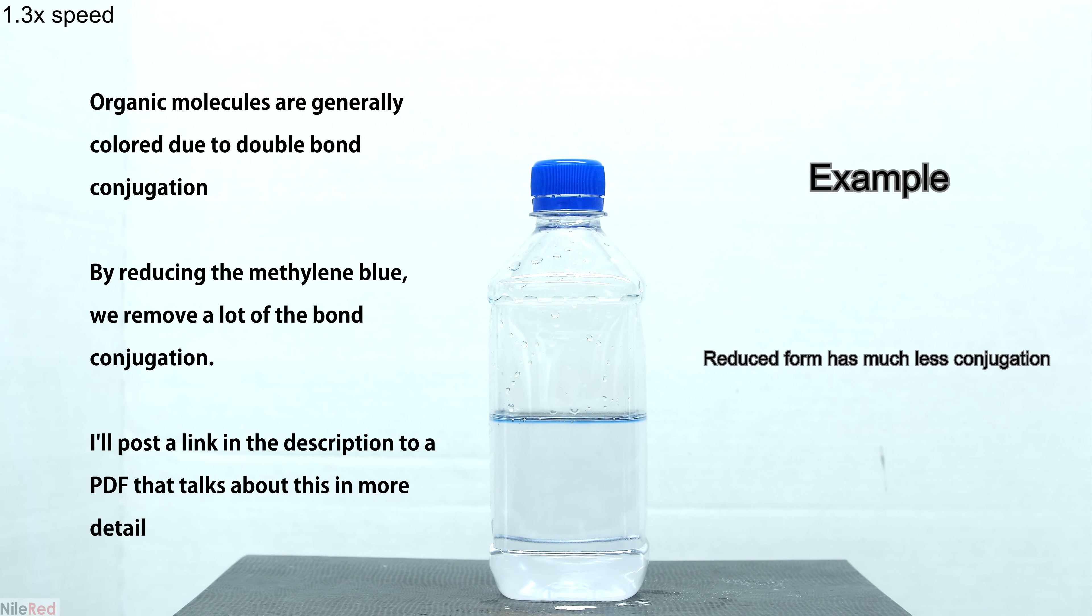I don't want to get into too much detail as to why the reduced form is colorless but I will write a little bit of detail on the side here and you can read it if you're interested.